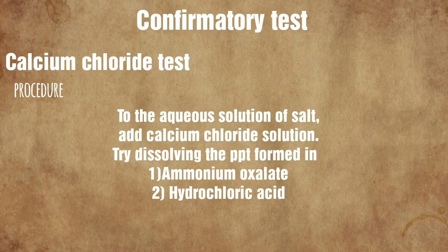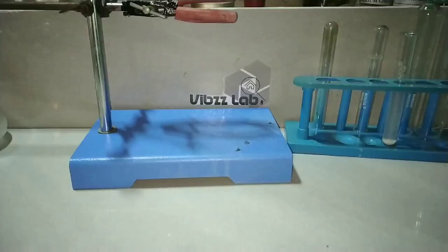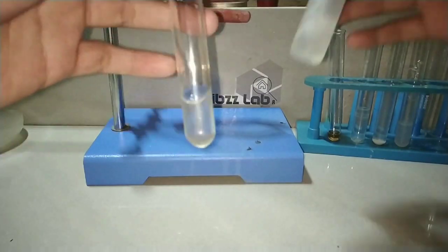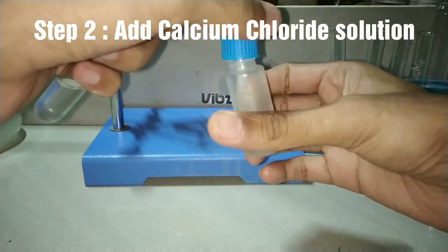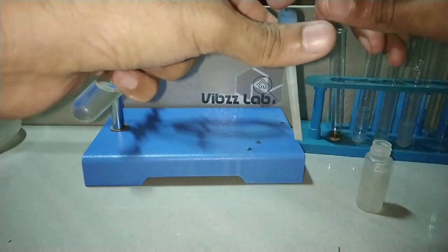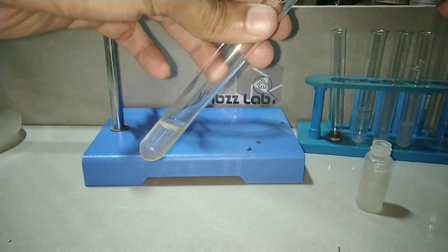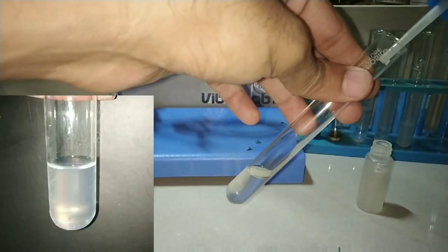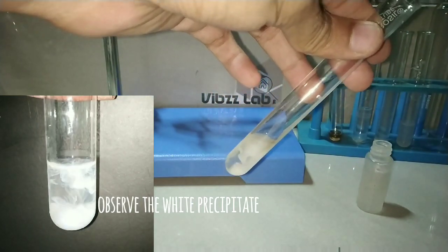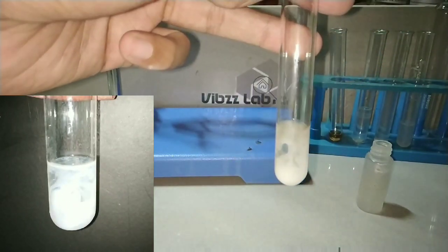In the calcium chloride test, we add calcium chloride solution to the aqueous solution of the salt. First, we take the aqueous solution of the salt, and now we will be adding calcium chloride solution. On adding calcium chloride, you can observe a white precipitate. We will divide this precipitate into three parts.